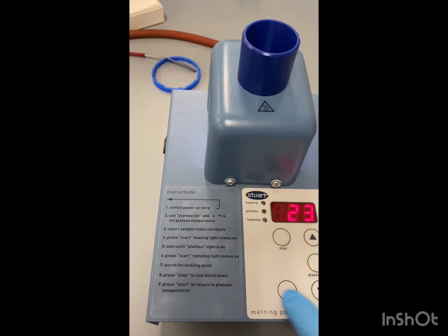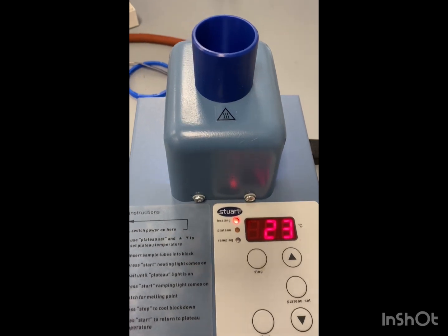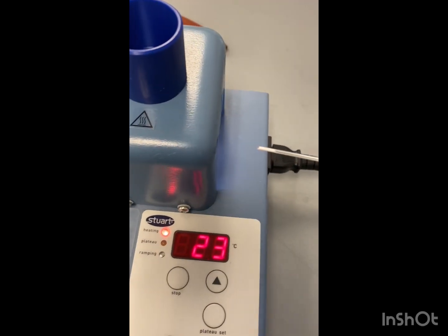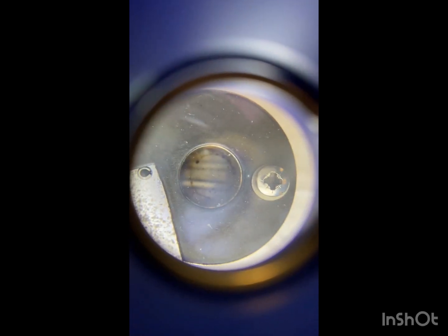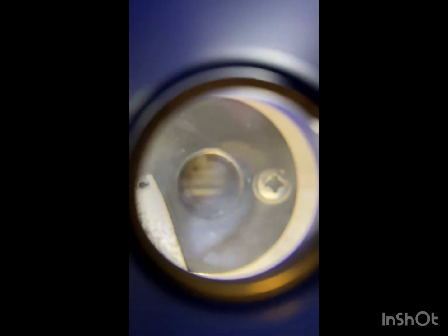So we're just going to go ahead and hit start and put our capillary tube in here. We want the tube where we can see it. All right, so it's a little fuzzy.